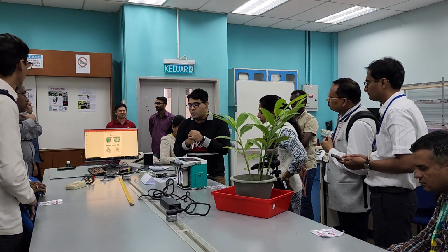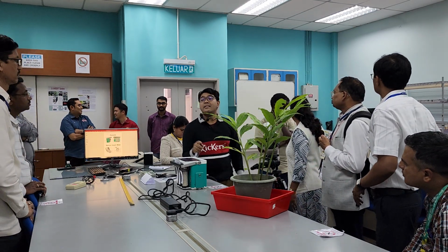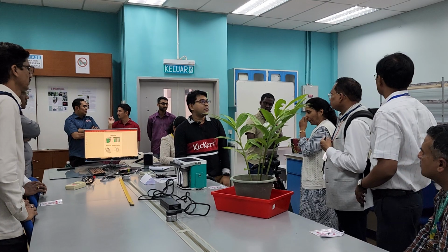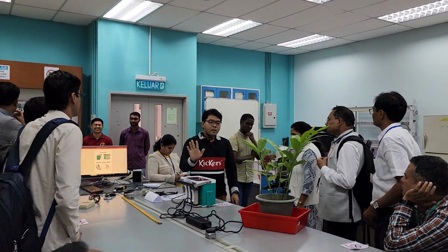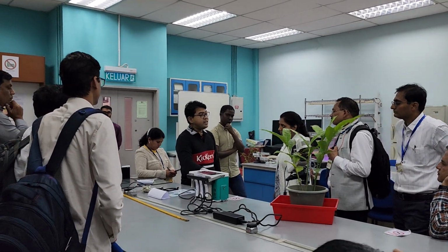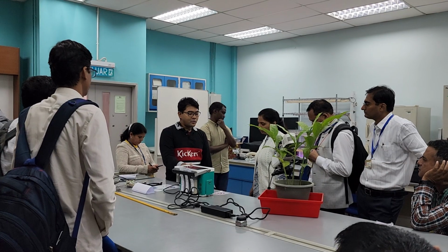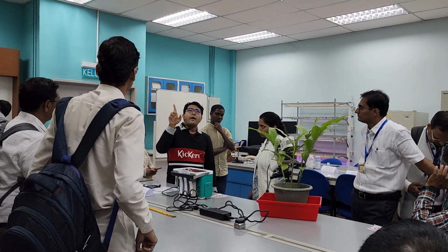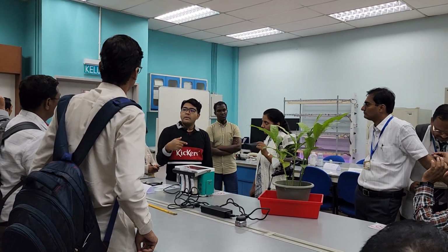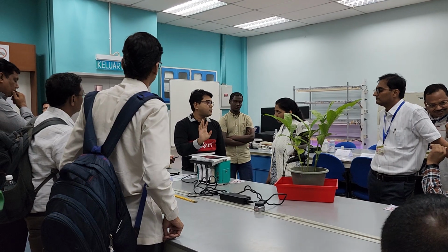Actually, this unit is kind of antique already. It is not produced anymore, but we happen to have it. From now on, there is a LICOR office in Delhi. I almost went there to give the training. Maybe you can contact them. All LICOR offices have a representative like me, a consultant, that you can ask for a quick demonstration.